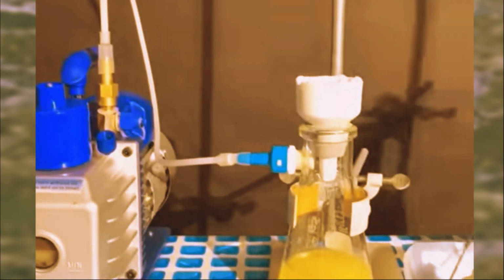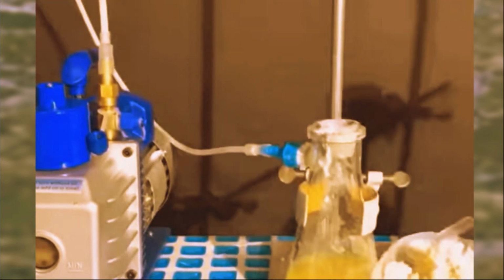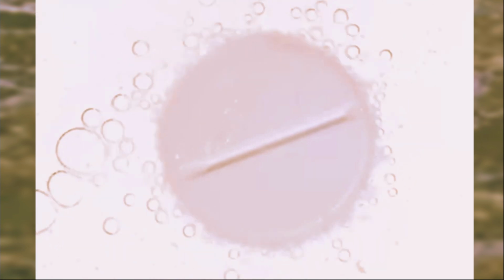Alright, so we've mixed our amazing ingredients and watched the chemical reaction create something awesome. Step 3, the purification process. But the aspirin isn't quite ready for use yet. It's still a bit rough around the edges, with some unwanted impurities clinging on. We need to separate the good stuff from the not so good stuff, a process called crystallization.